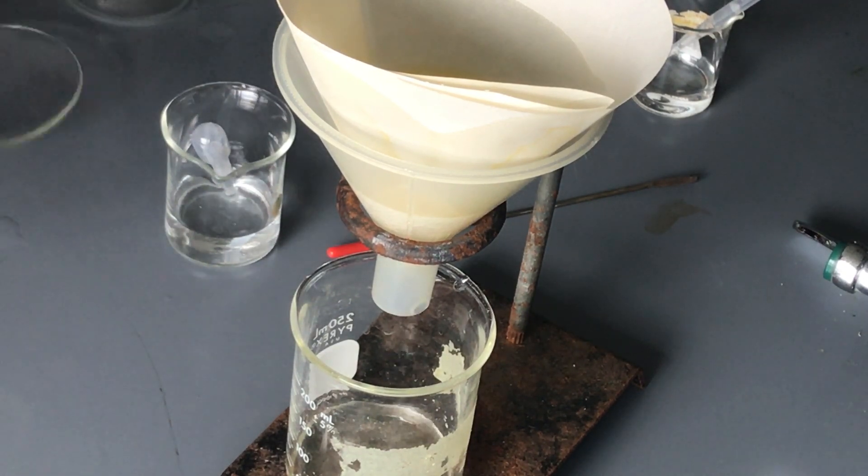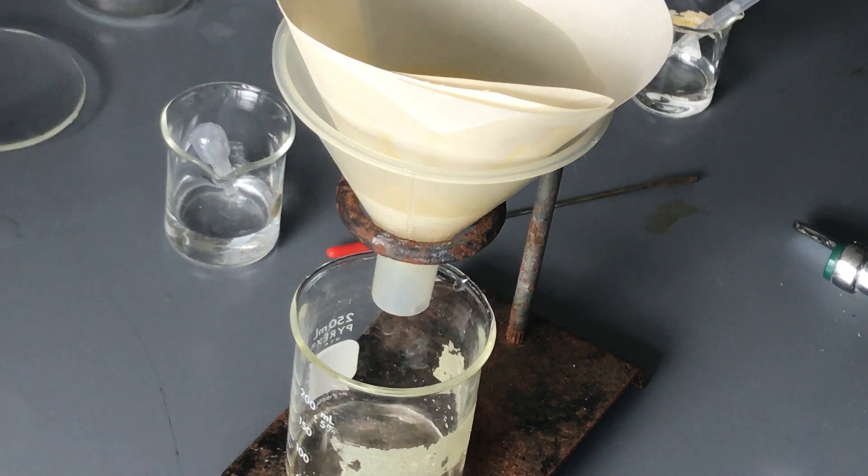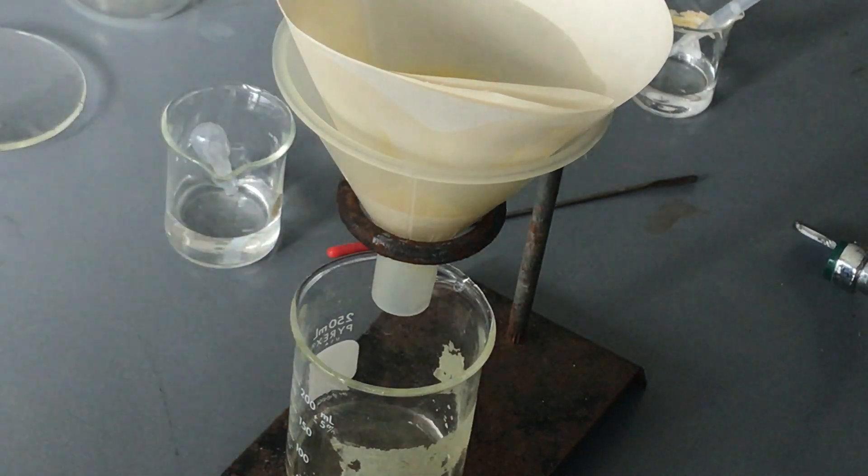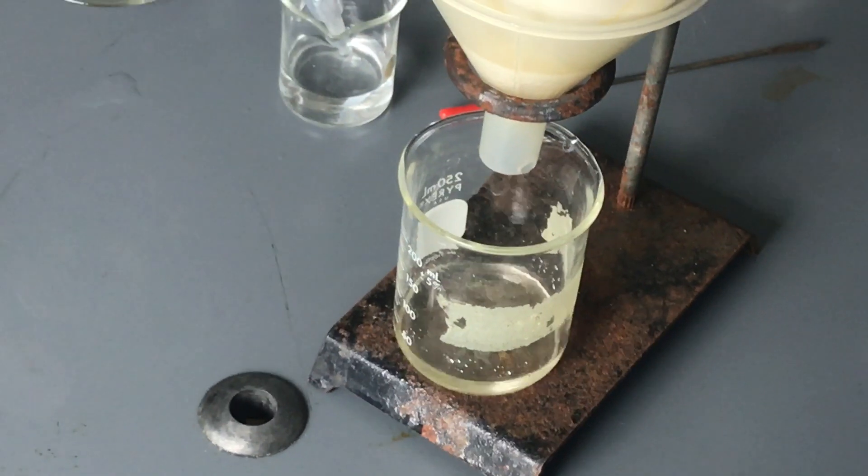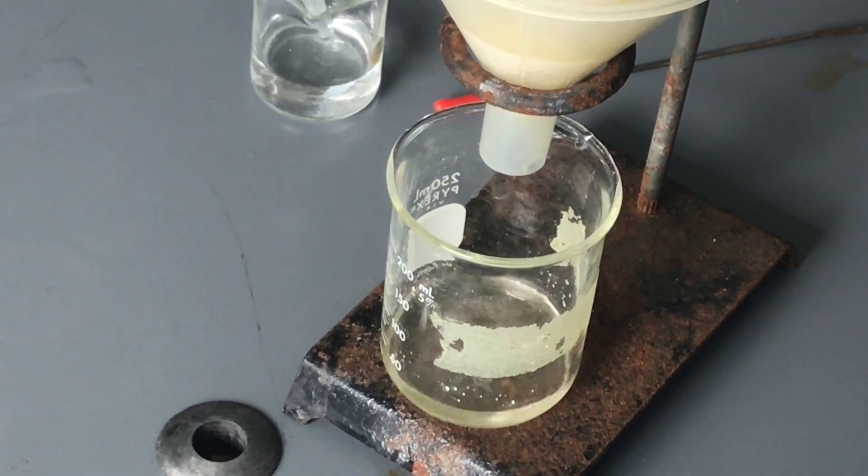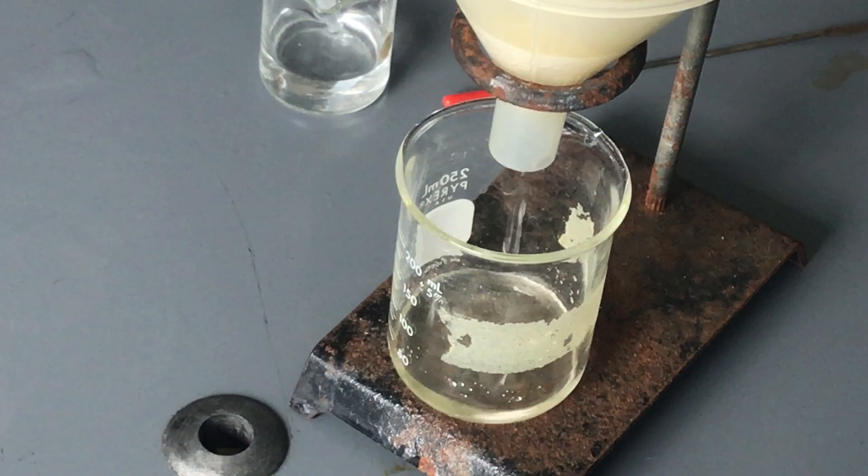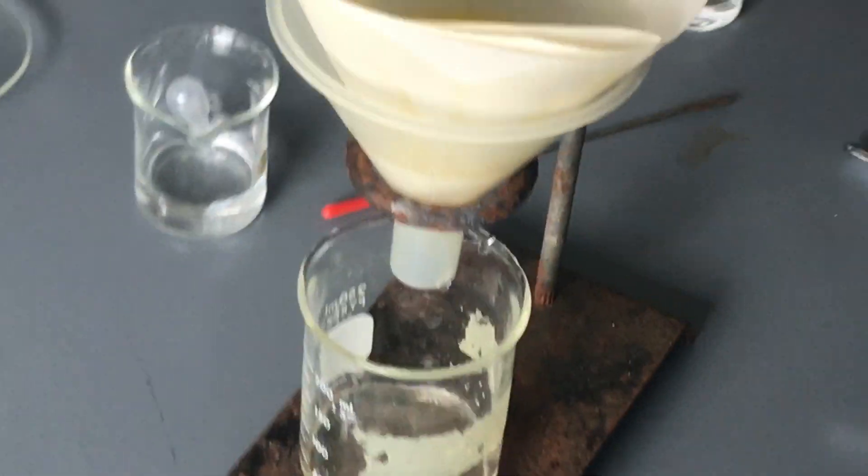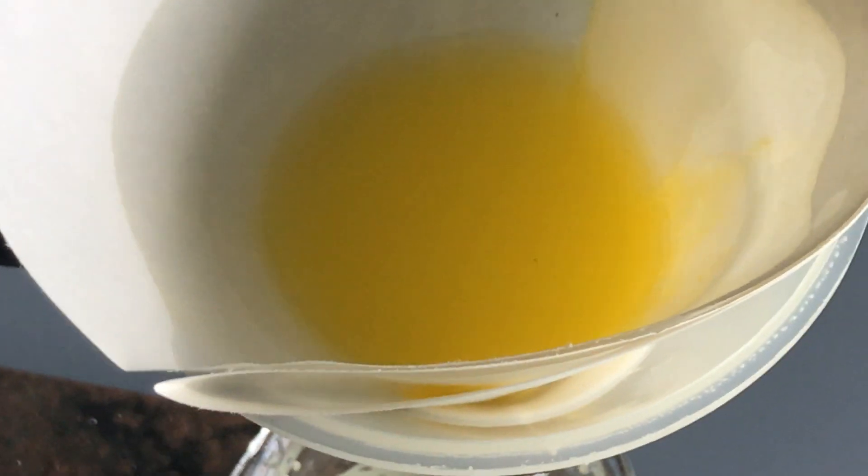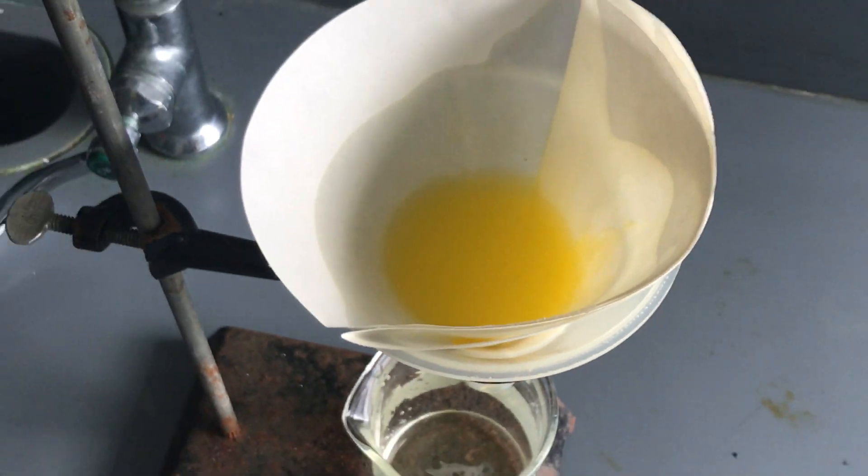And so we're just going to continue to wipe it all down, try to get as much as we can. The water at the bottom is a lot clearer than the other one was. We're gonna zoom in here, bear with me. That's a lot clearer than what it was before. The one that I showed you a few minutes ago was quite yellow still. And the filtering process will come through here and we'll actually see that it is capturing all the yellow. And over time this will continue to settle out.